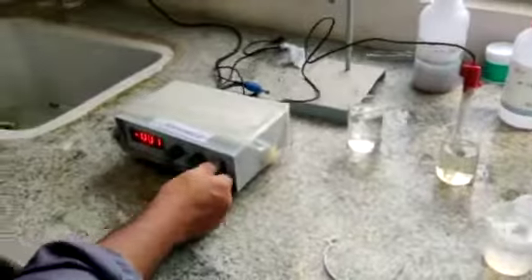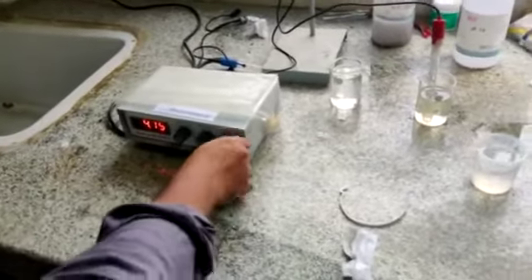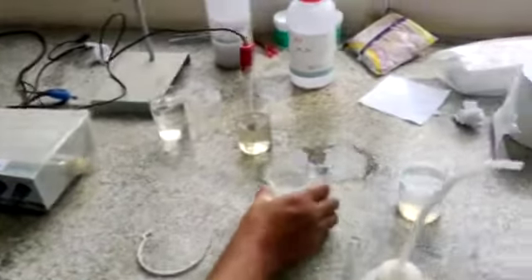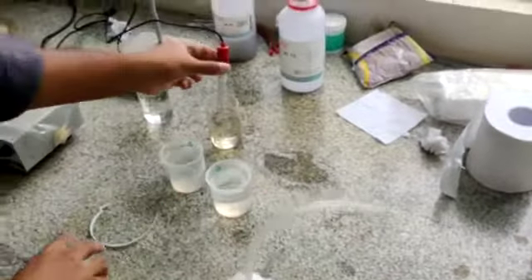This is not required. This is just to check. So, this is all some samples I will give. So, after completing this, again you just clean this using tissue paper.